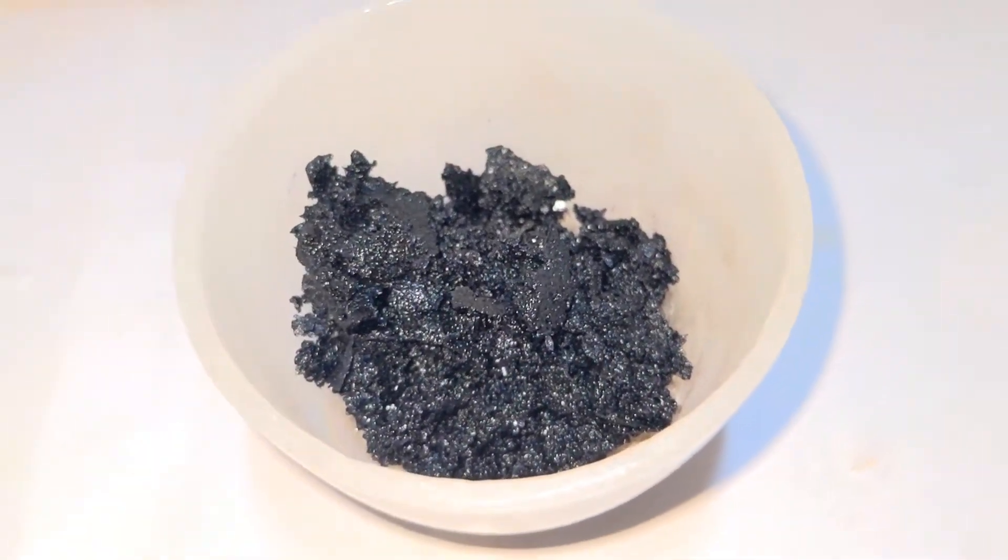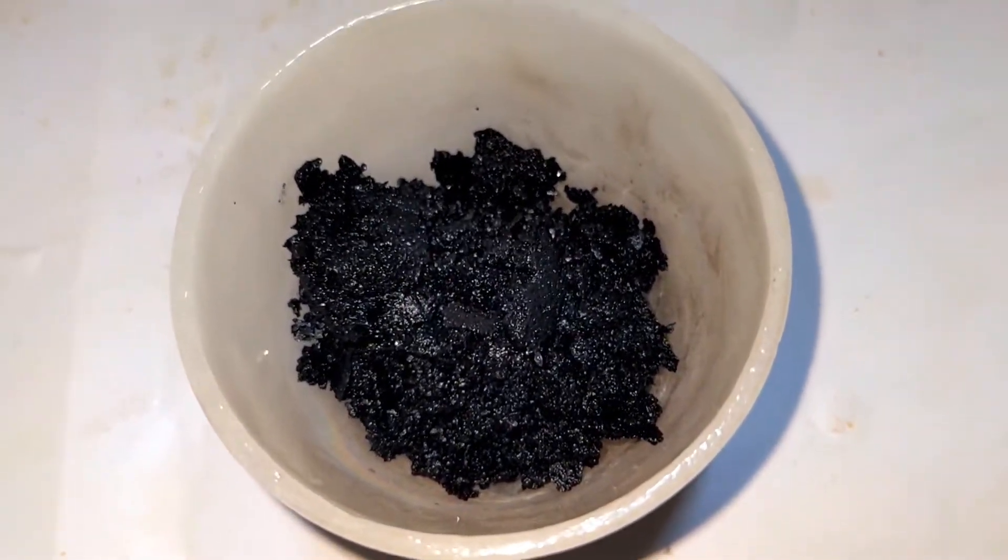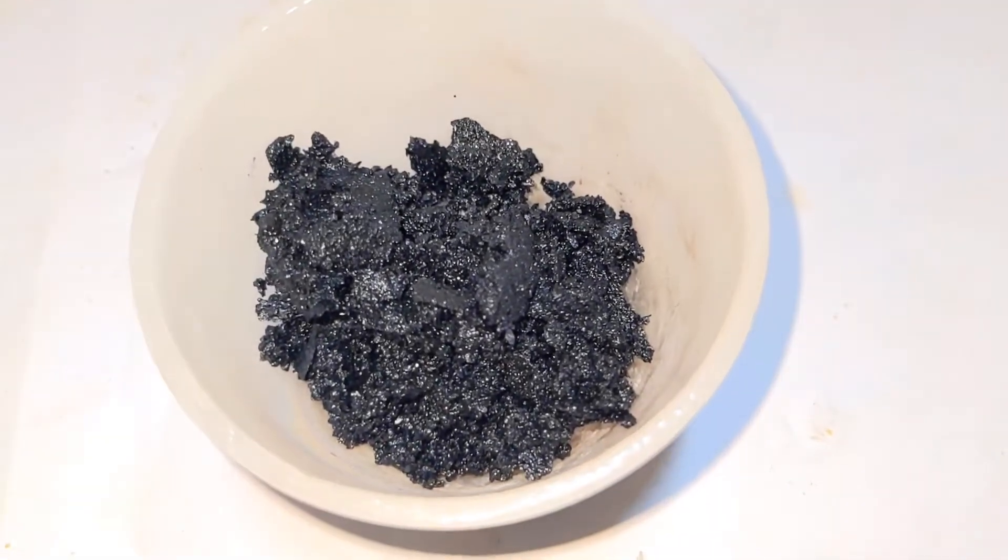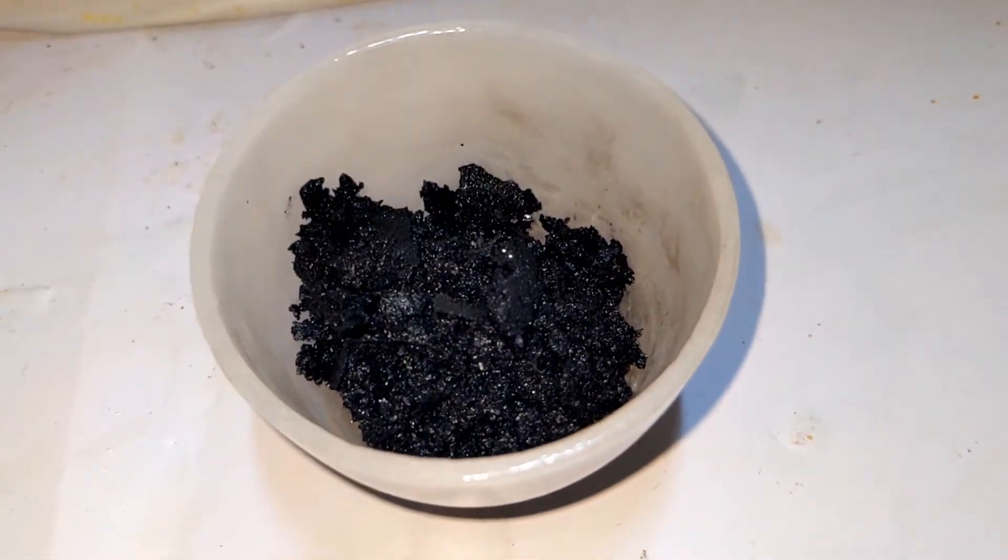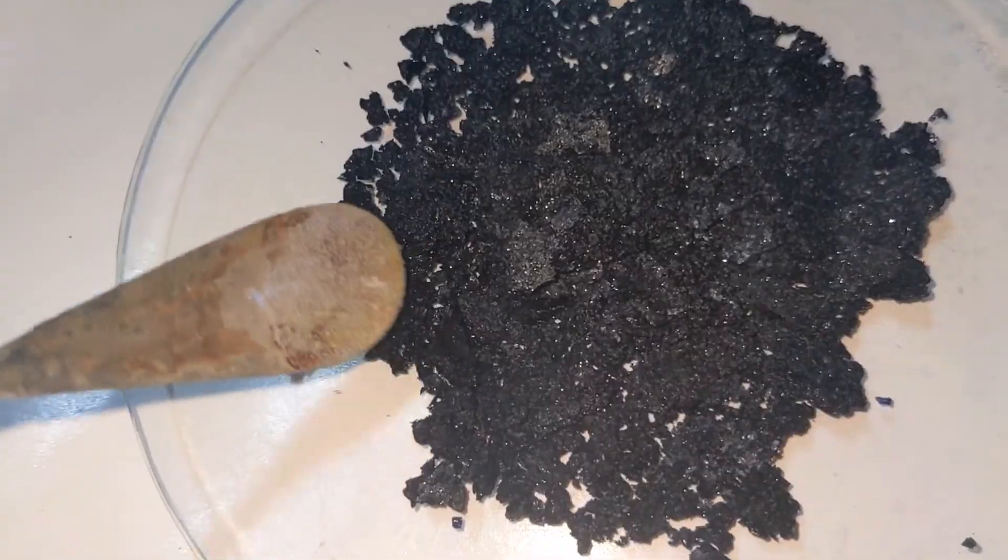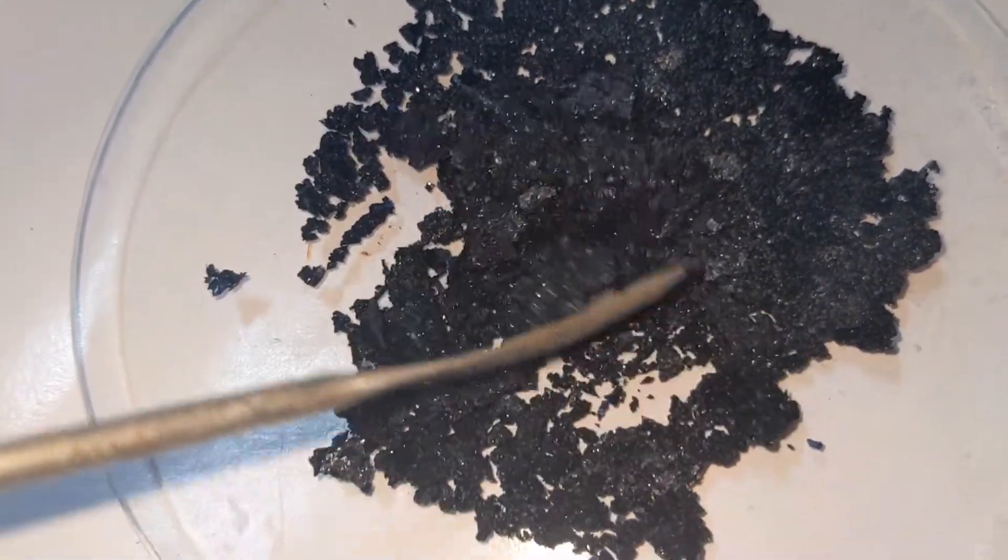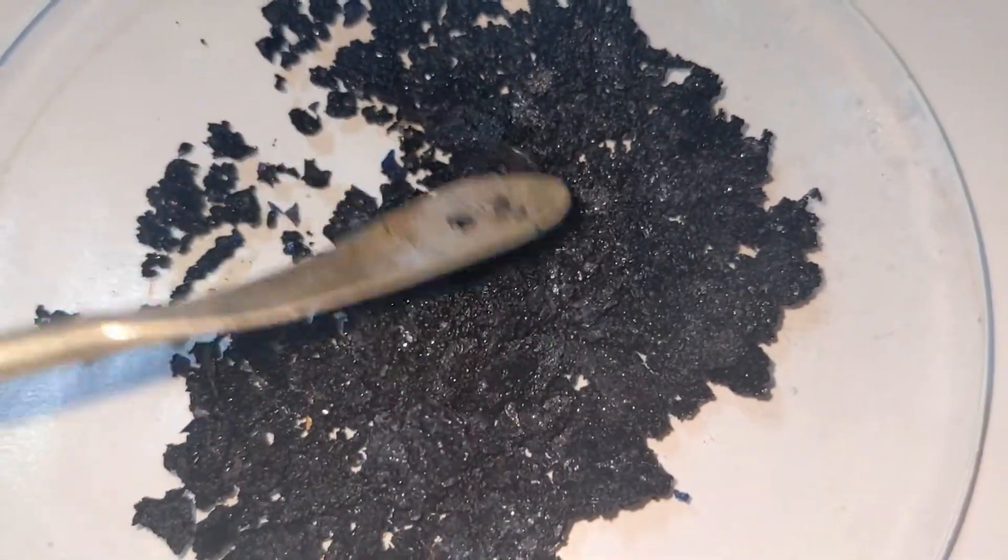The crystals were then filtered using vacuum filtration, washed a couple of times with about 96% ethyl alcohol, and allowed to dry. This is the final product that we obtained after drying.